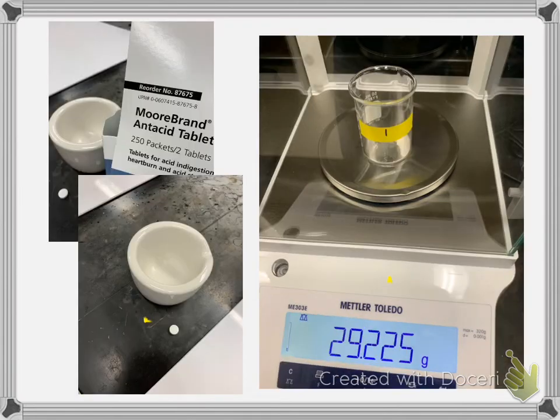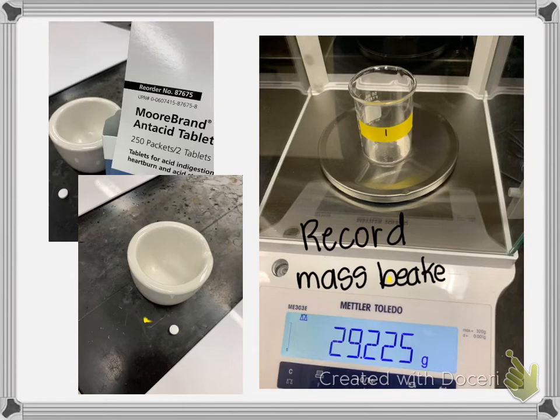So now let's do the Moore brand. And I don't know if you can tell, but the Moore brand sample, the tablet, is much smaller. So this is the Moore brand. And here you're going to record, for the Moore brand, the mass of the beaker plus the antacid.